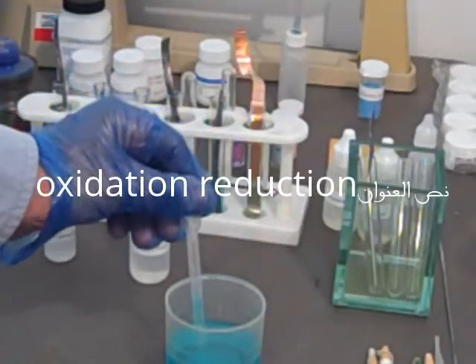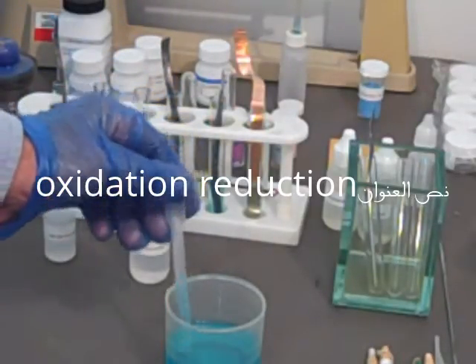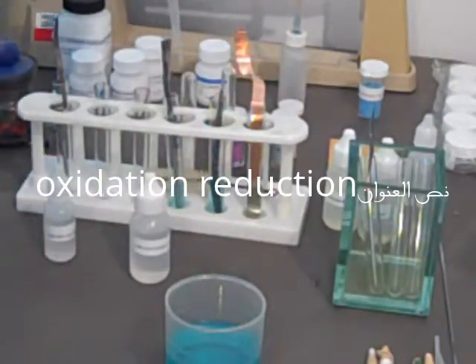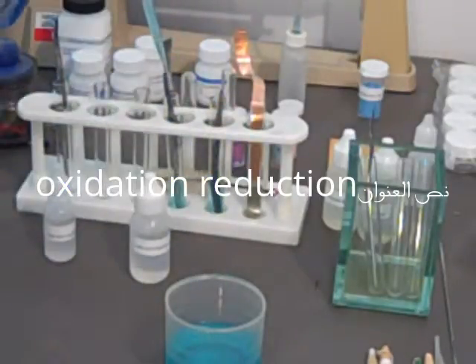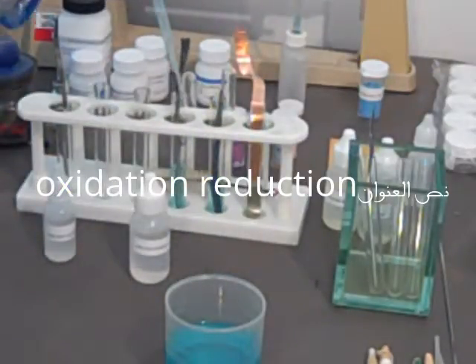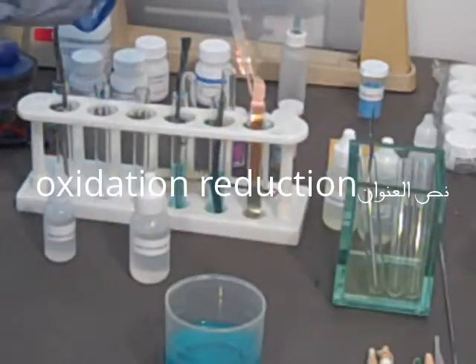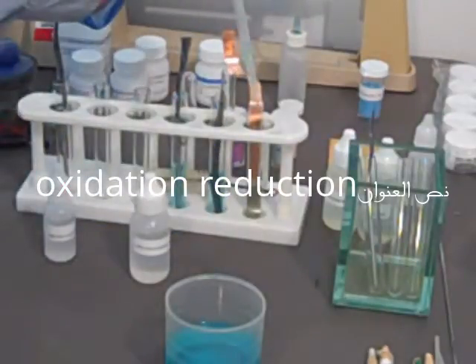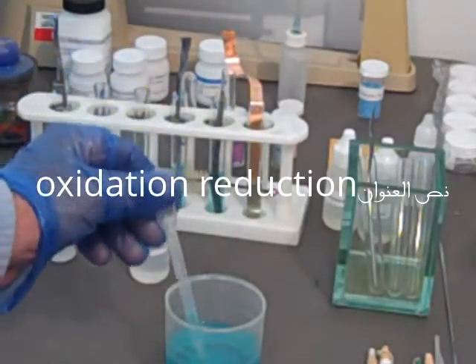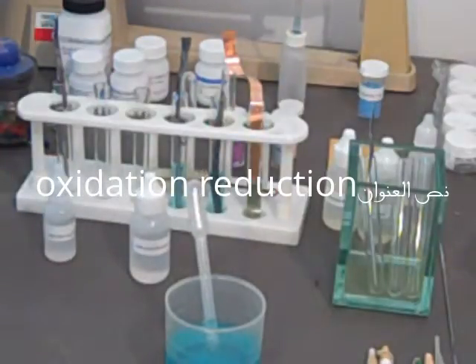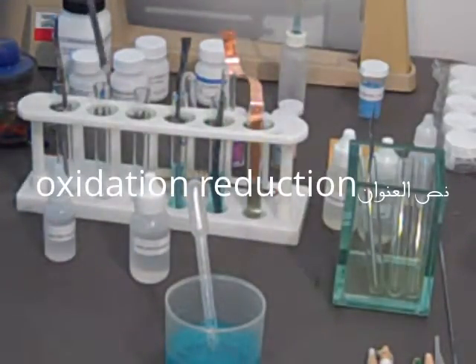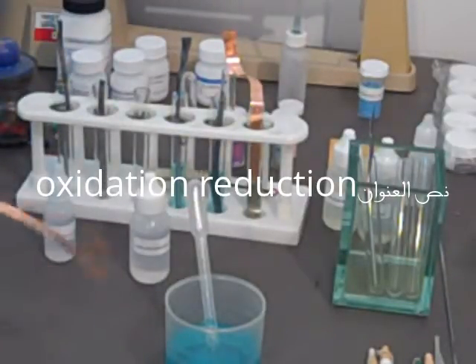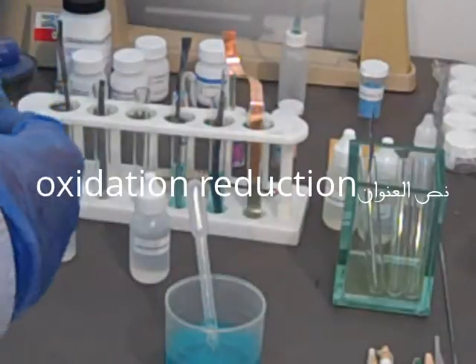A little bit short there—we'll add a few more drops later. Right down the outside of the tube. We haven't done this yet. This is the first run. You can see change already on the lead. I believe we can. This should be more reactive even than the zinc.